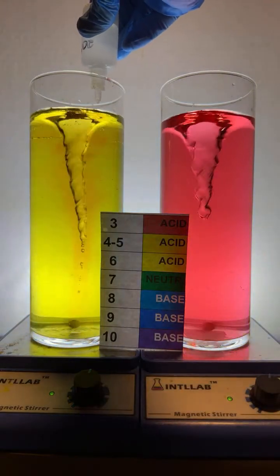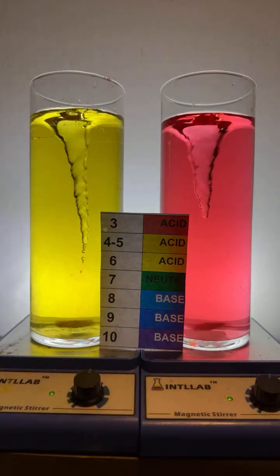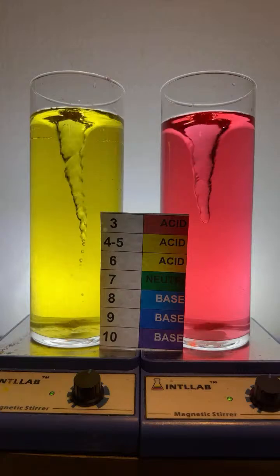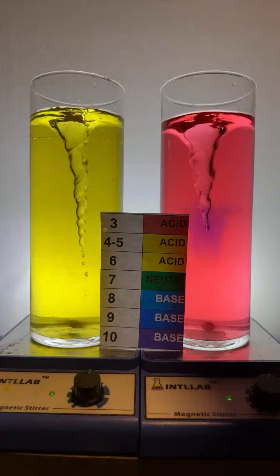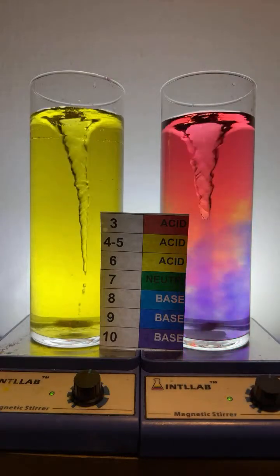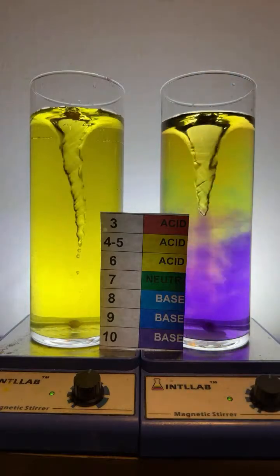Look at this. I'm adding a bunch of acid. I'm dropping it in like crazy over here on the left. In the buffered system, nothing's happening. All right, let's add a drop of base over here on the right. Boop, and it goes. Give me the rainbow. Come on, there it is. I'm loving the flash of rainbow.